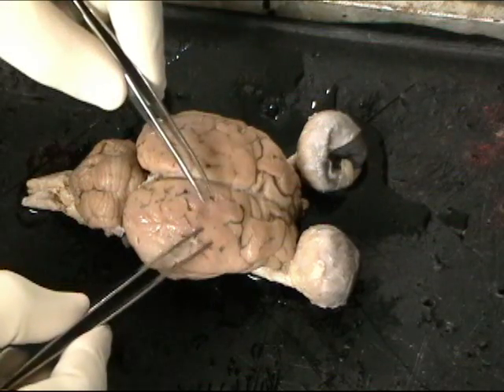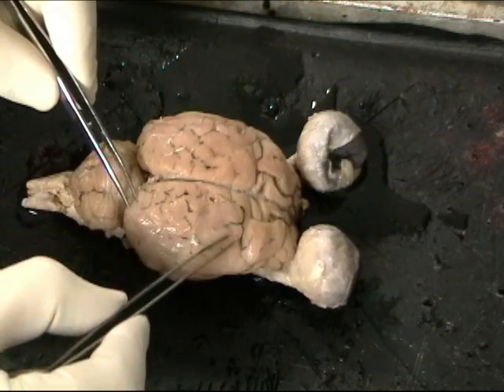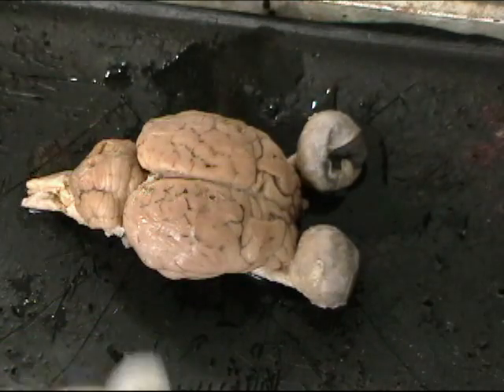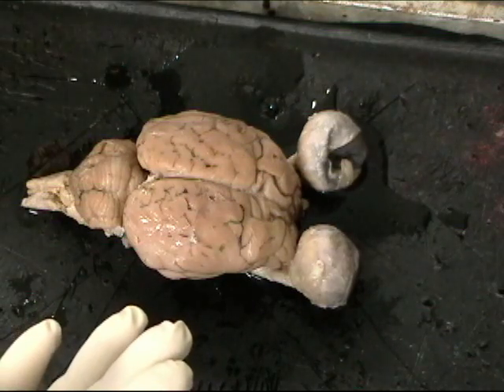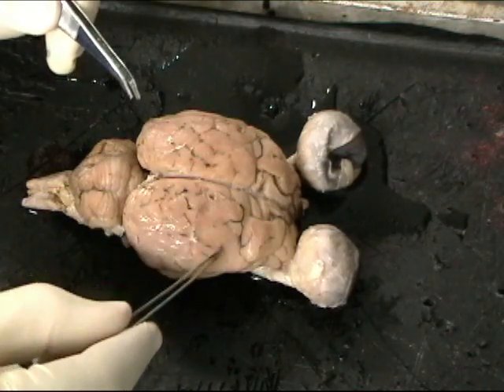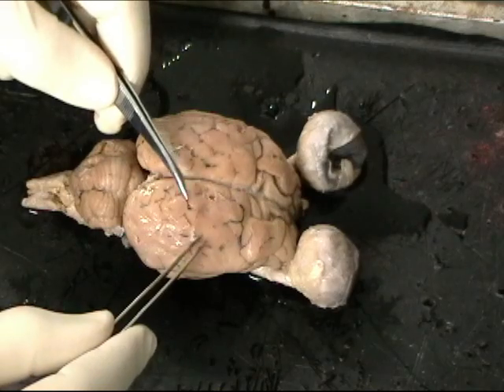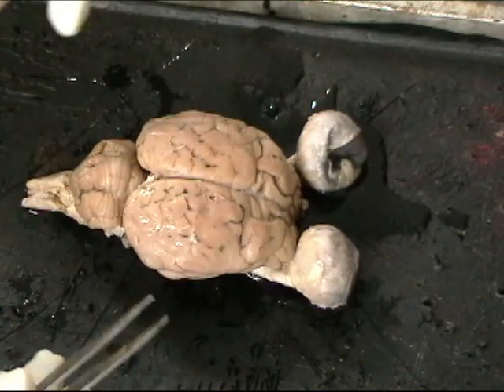The parietal lobes also contain the sensory cortex for touch. So things that we touch, the axons from sensory cells in our hands and fingers and all over our body, that touch information ultimately gets registered by cortical tissue in the parietal lobe. And in addition, this parietal lobe seems to be involved in representing the self located in space.